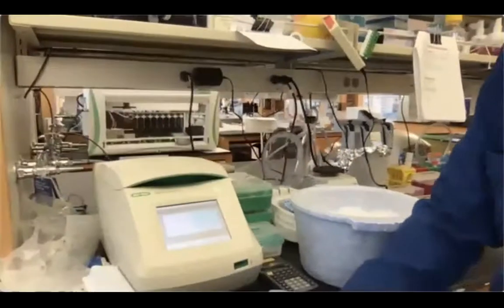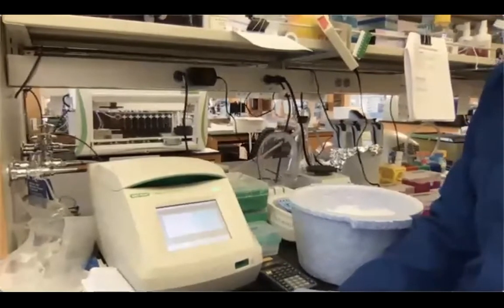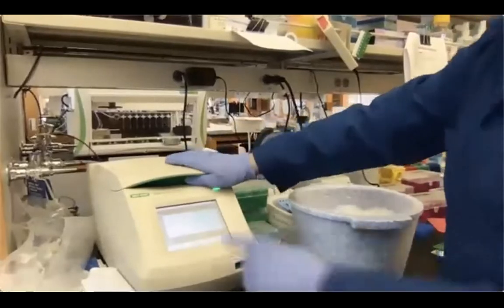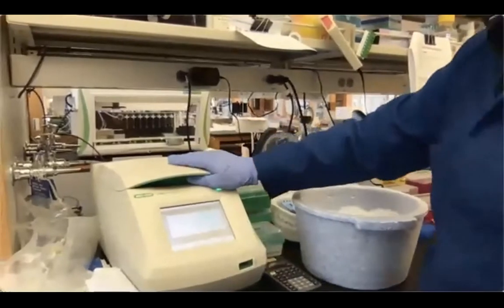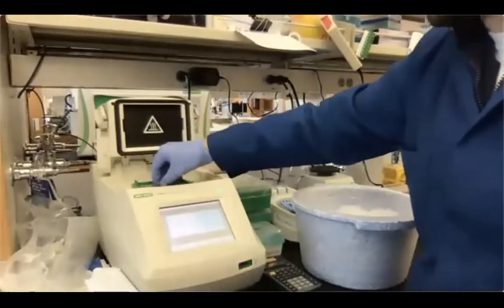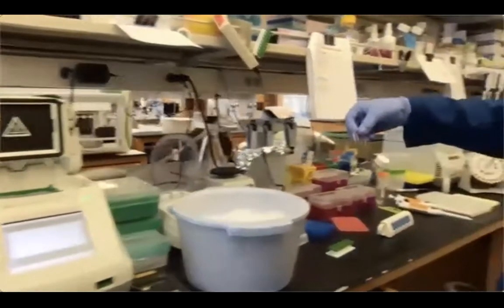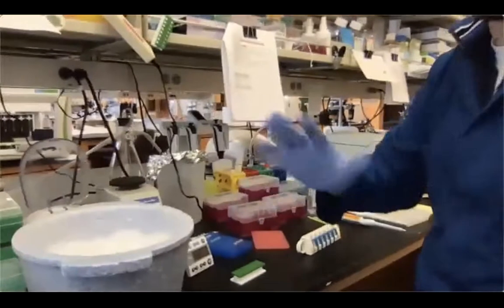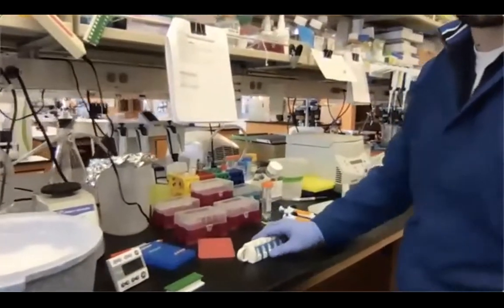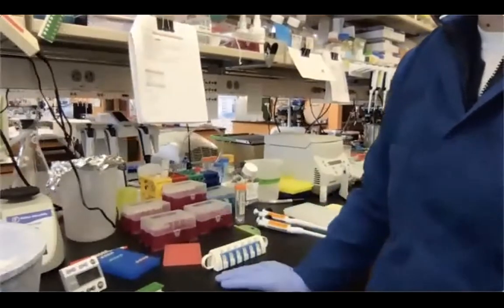All right, so here we are again. The ligation just ended. So I'm just gonna take my tubes out. You see that the temperature is going down to 12 degrees. Also before it was 20 degrees, so it's colder than room temperature. So what we're going to do is we're going to incubate our samples at room temperature for a couple of minutes just to have them at room temperature, because all the steps that we're going to perform, so the library purification, will be performed at room temperature.